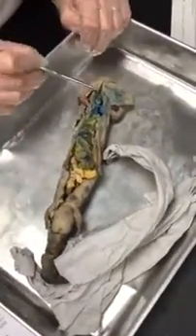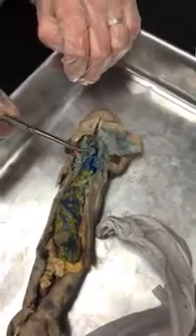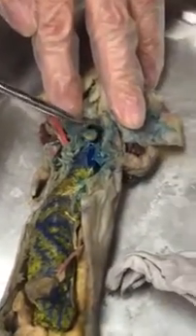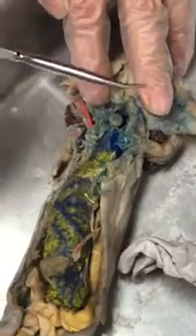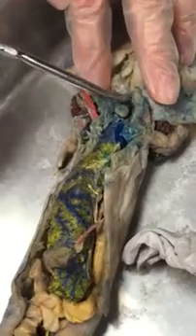Later in the semester. So the first thing to orient yourself is find the ventricle, the one ventricle, which kind of looks like it might be the whole heart, but it's just the ventricle. And then behind that, the little flaps, can you see all right? Are the left and right atria. So it has 2 atria.